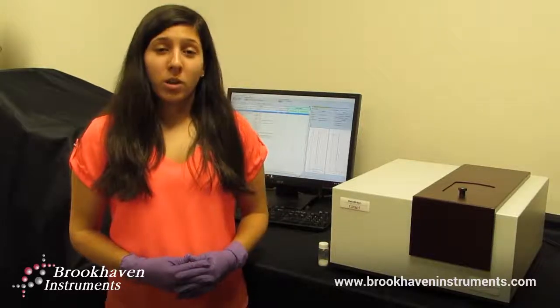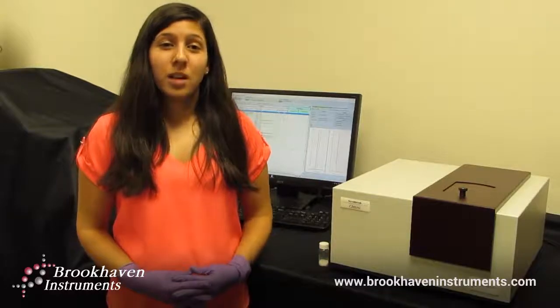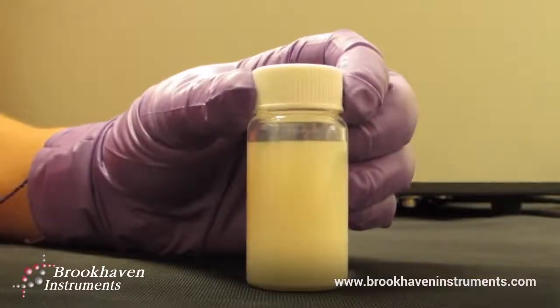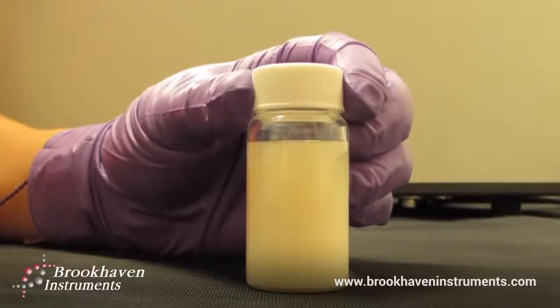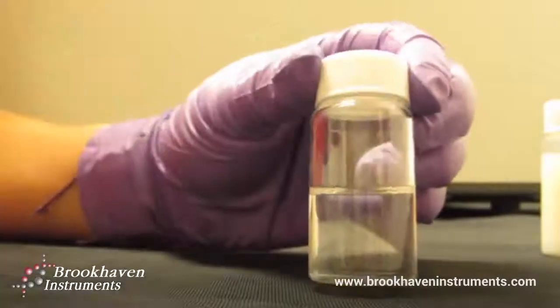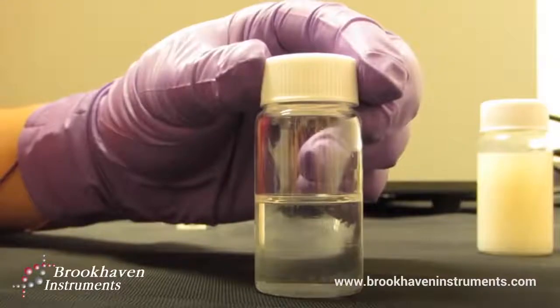We are going to perform some quality control testing on a sample of micronized zinc oxide to make sure the particle size meets quality standards before it moves to the next phase. About a spatula tip's worth of the powder has been suspended in an oil with a wetting agent. Sonic power was used to further agitate and disperse the sample within the medium, yielding a concentrated dispersed sample. One drop of this in 10 milliliters of fresh dodecane with wetting agent gives a slightly turbid sample at the perfect concentration for measurement.